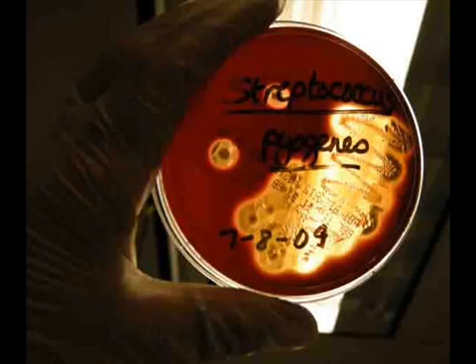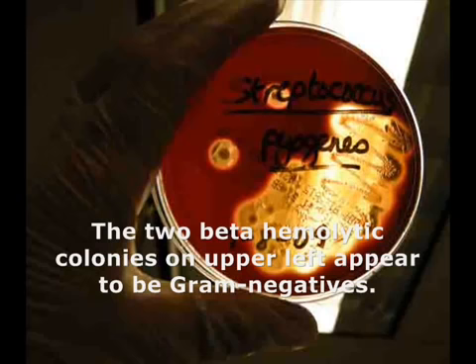Colony morphology refers to how different types of bacterial colonies look growing on agar. Gram-negative bacteria growing on blood agar form larger colonies: large, round, flat, grayish or tannish colonies. We can see a couple of examples on the upper left side of this plate. The two circles of beta hemolysis that you see were caused by gram-negative organisms.